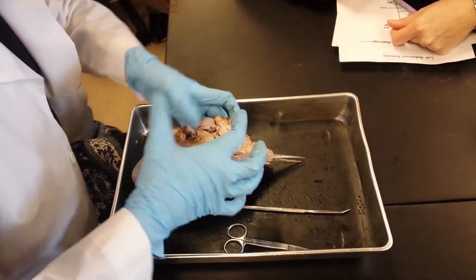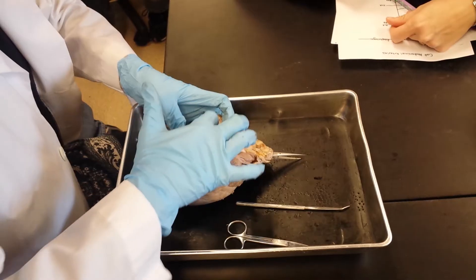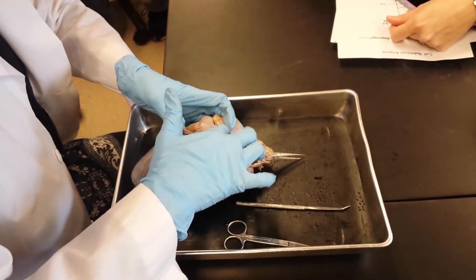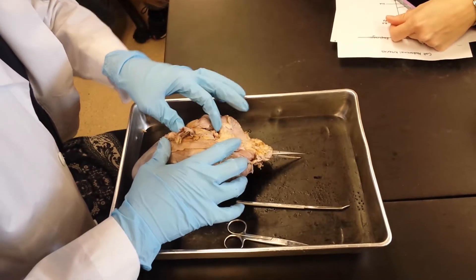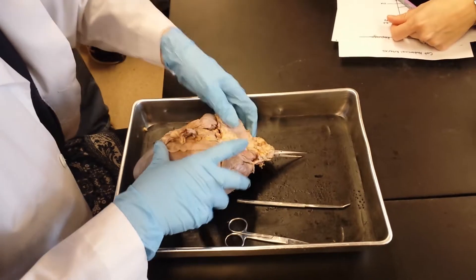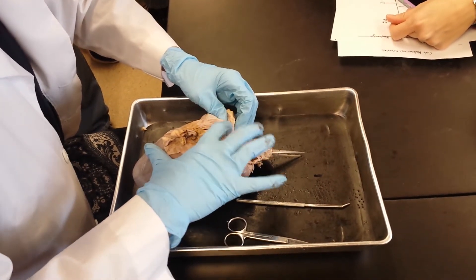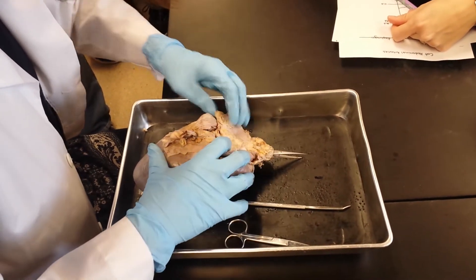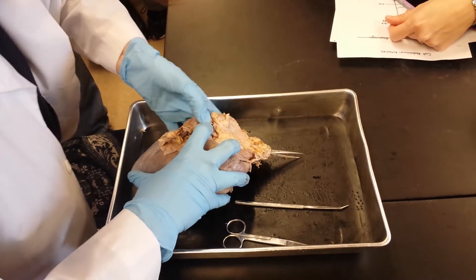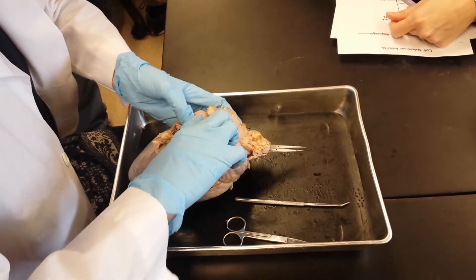Usually the veins are inferior — veins are down here, inferior to the arteries which are usually further up. I'll try to make sure I get a nice thick muscular pulmonary artery for you and a nice collapsed obvious pulmonary vein.